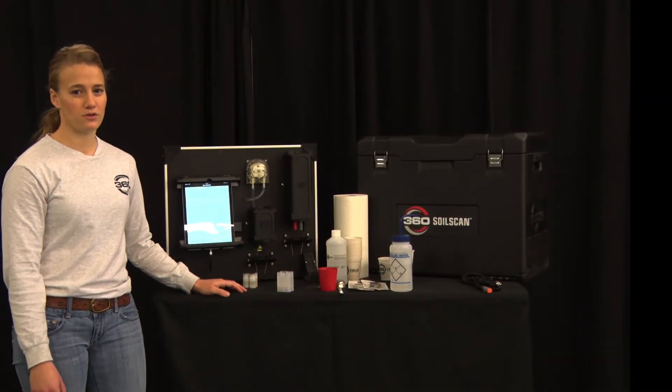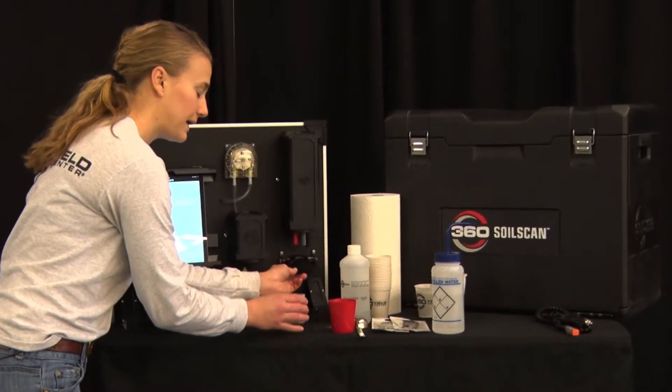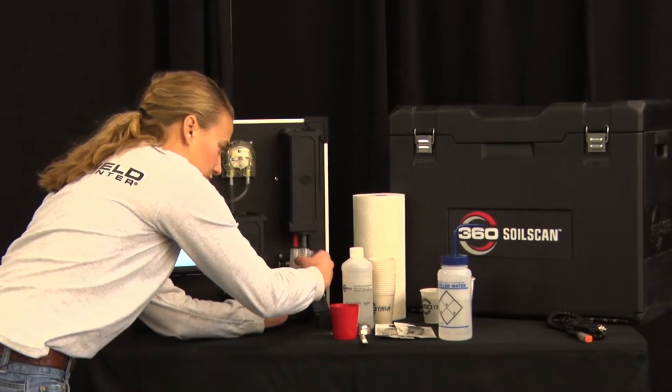If you're going to be using your soil scan within the next 24 hours place your sensors in the calibration cup with the nitrate solution to soak.